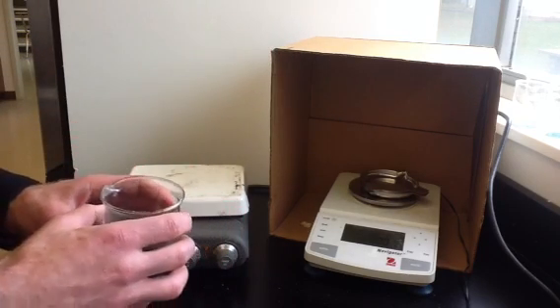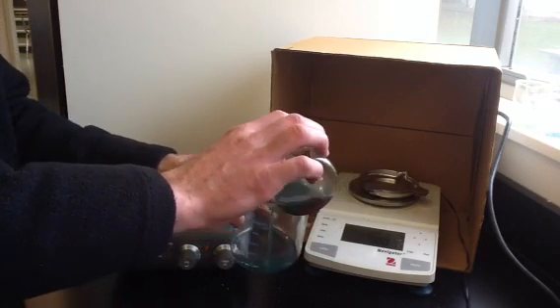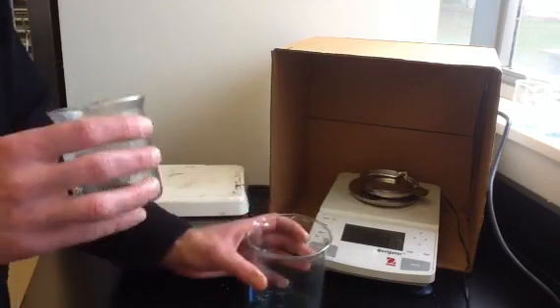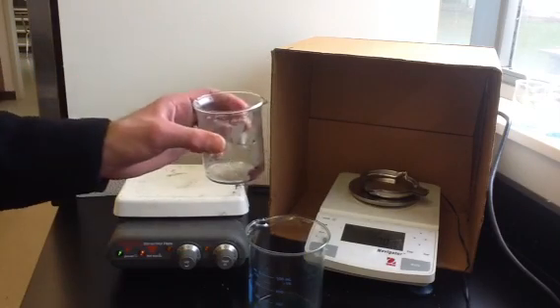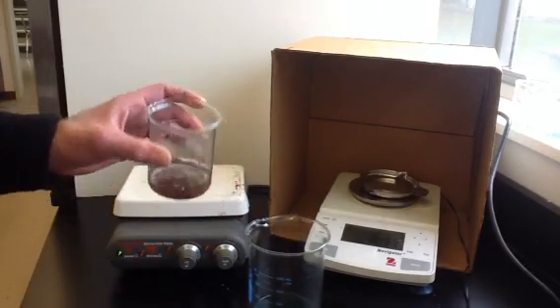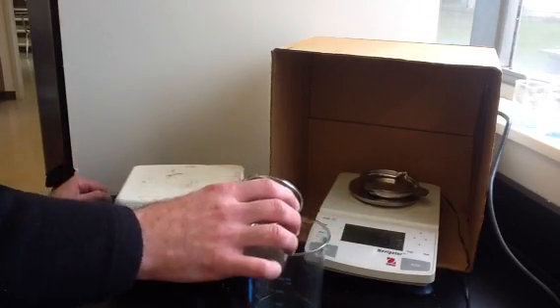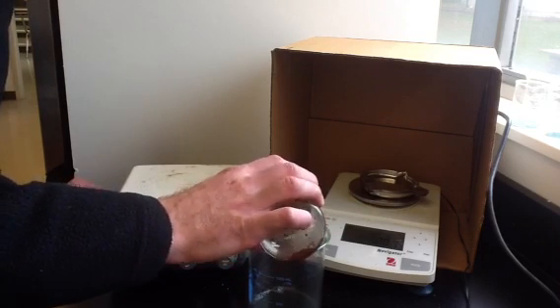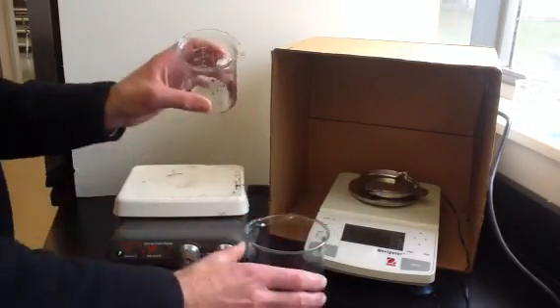Once we think the reaction has completed, we're going to pour off some of the liquid on top, trying not to lose any of the copper on the bottom. If we pour it out slowly, we can get rid of the liquid and keep the copper. Before we can weigh this, we need to wash it off and dry it. I'm going to add a little bit of water, swirl the copper around, and then pour off the liquid again, trying not to lose too much of the copper metal.